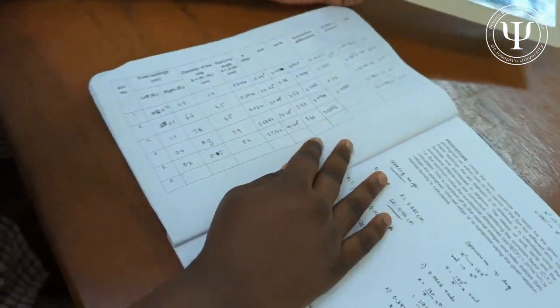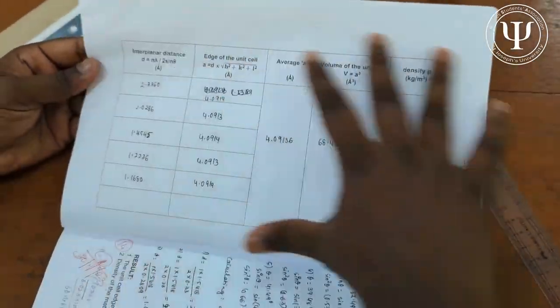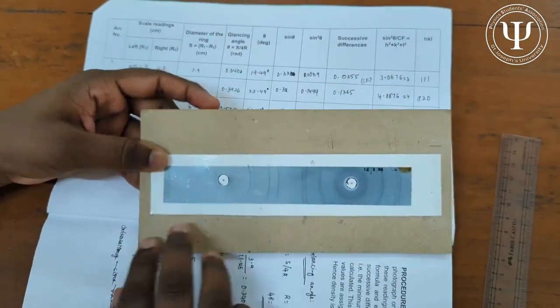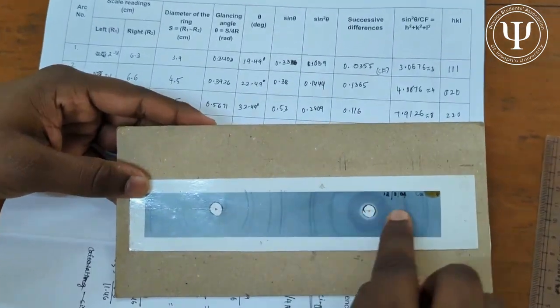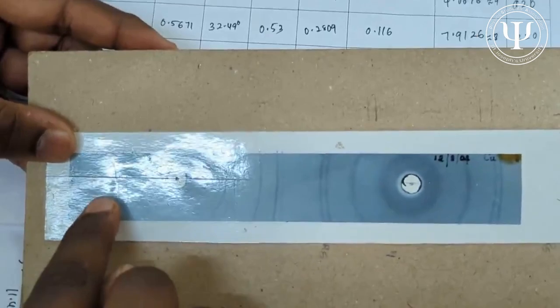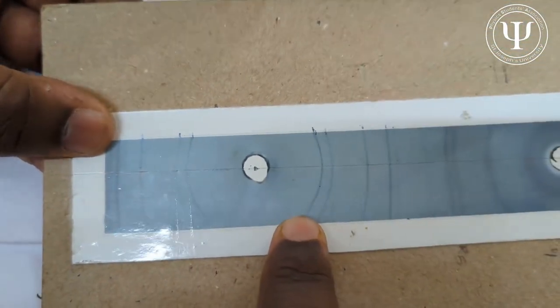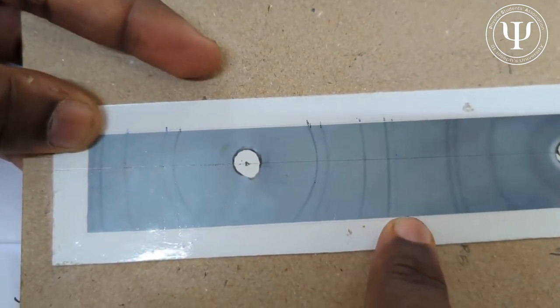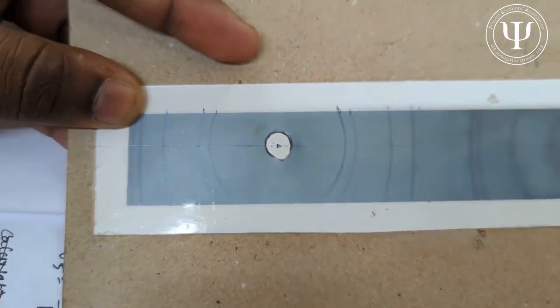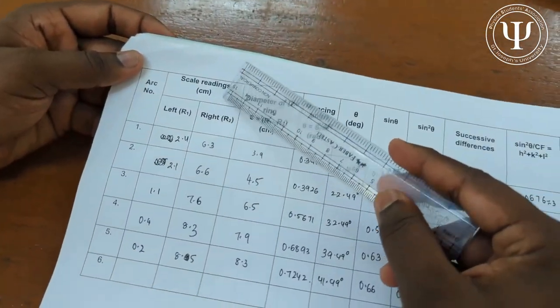Moving on to the experiment, you have to make a table — it requires several tables. In the photograph, there is a center middle line passing through the centers of the small circles, and there are five corresponding arcs for each small circle: arc 1, arc 2, arc 3, arc 4, and arc 5, symmetrically on both sides.